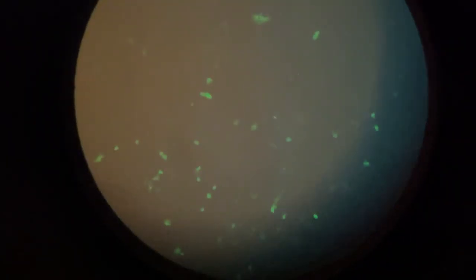Let's see if we can catch it here. Adjust the focus. If I move it around on the stage, you can see new cells.